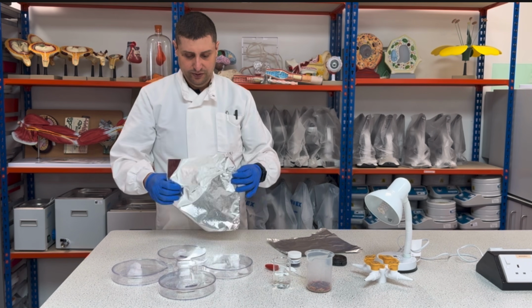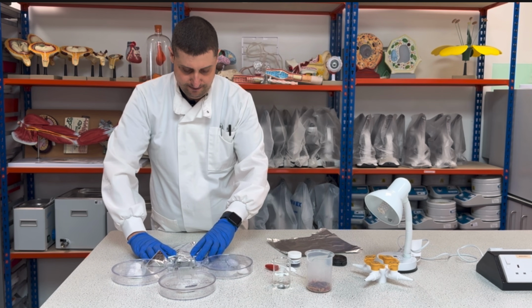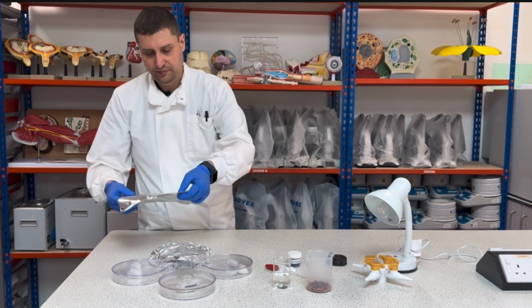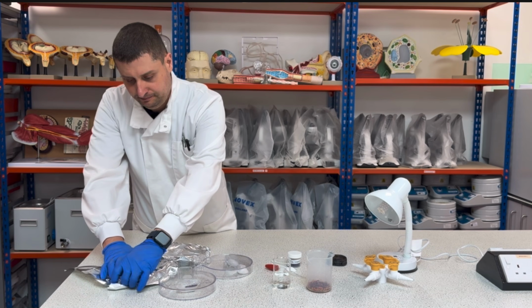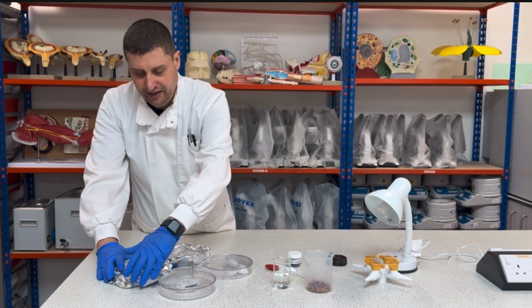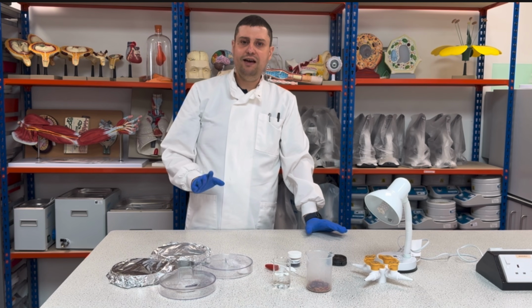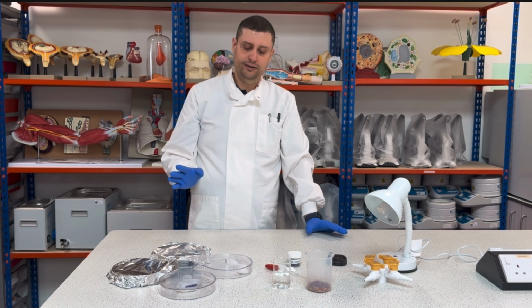One dry and one moisture. You don't need to worry if there is a little bit of light going inside the chamber. The big point here is to have as much dark as possible, but it doesn't need to be completely dark.